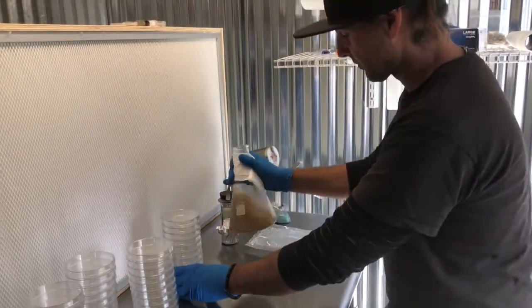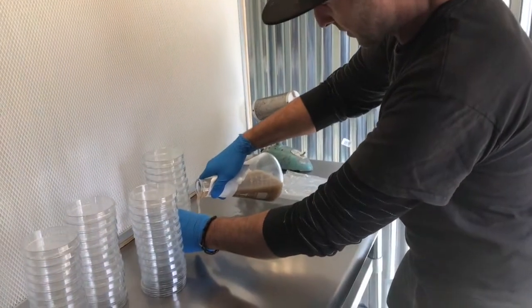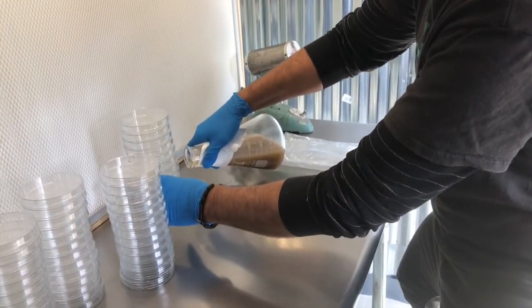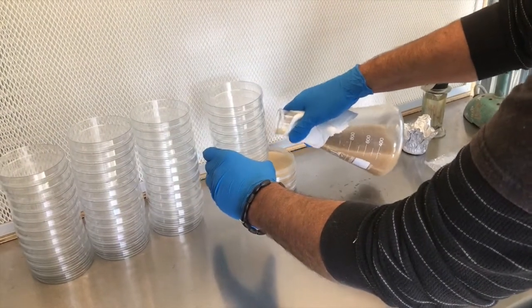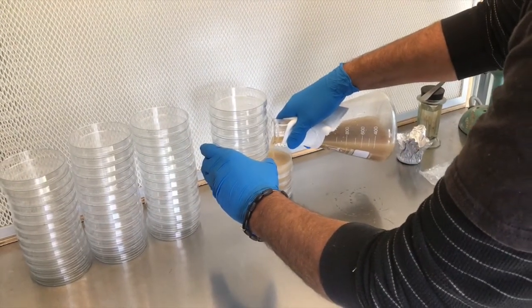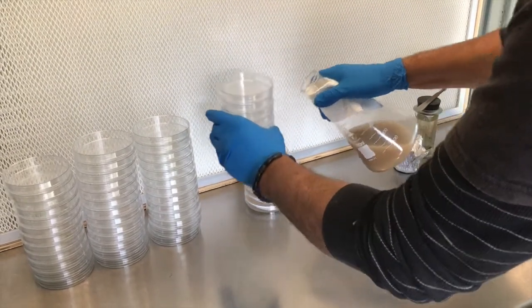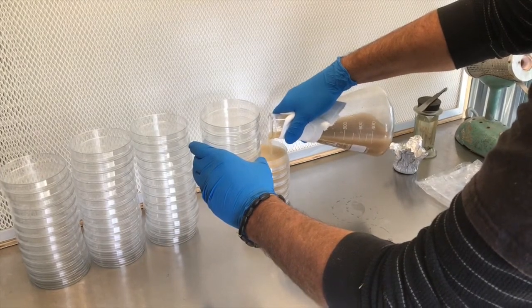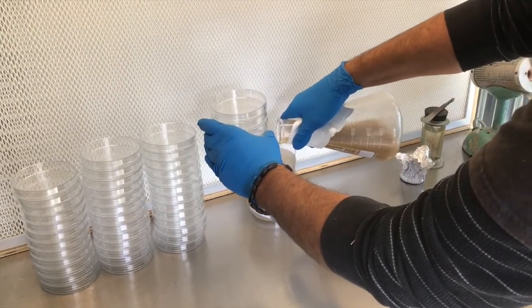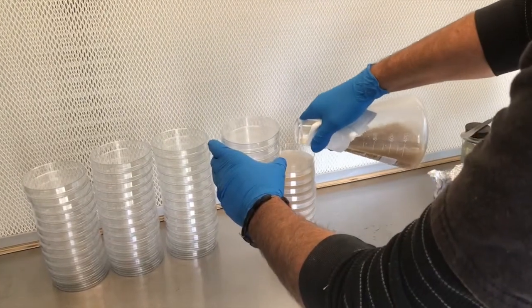If you've got a chair in your lab that's great; otherwise I'm kind of tall so I take a wide stance. Pouring plates is pretty simple, and it will let you know if your table is exactly level or not. We're just filling up the plates enough to cover the bottom — it doesn't have to be super thick. Every once in a while since this is DFA there's some chunkier stuff in there, so I'll give it a little swirl, but you don't want to create too many bubbles because they'll cool and leave marks on your petri plates.